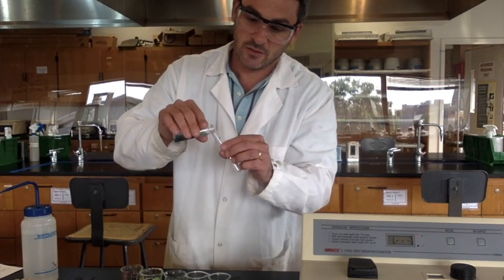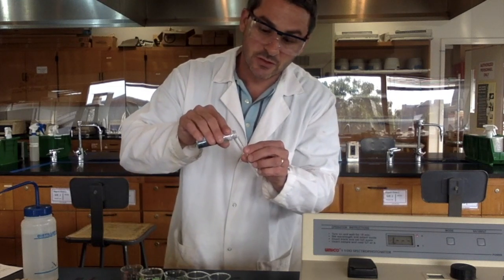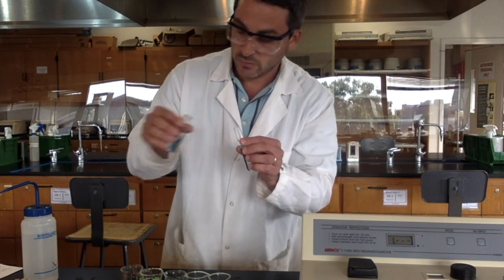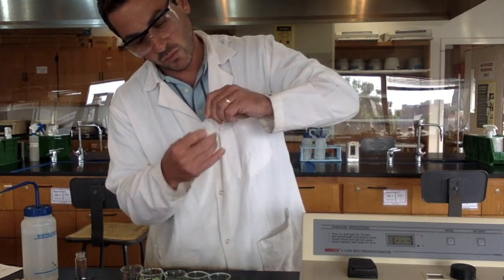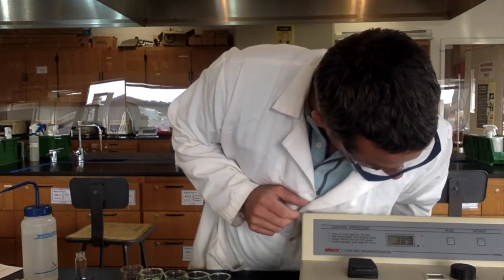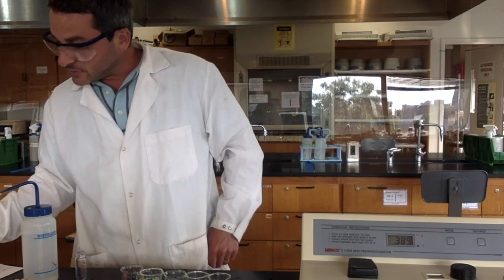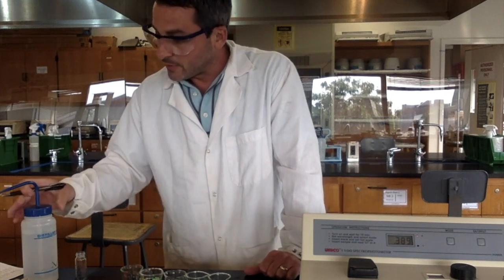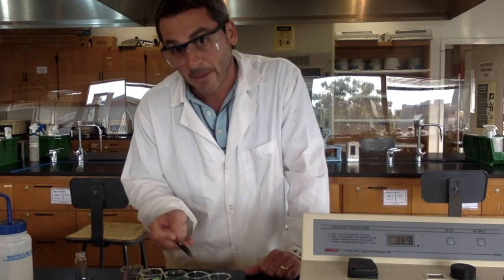because that is how you do it. And then I'm going to just simply record the absorbance of this unknown. The absorbance is 0.389. Now, just looking at this, and I don't know the concentrations right now, we didn't go over that, but the absorbance of the unknown is in between the absorbance of beaker C and beaker B.